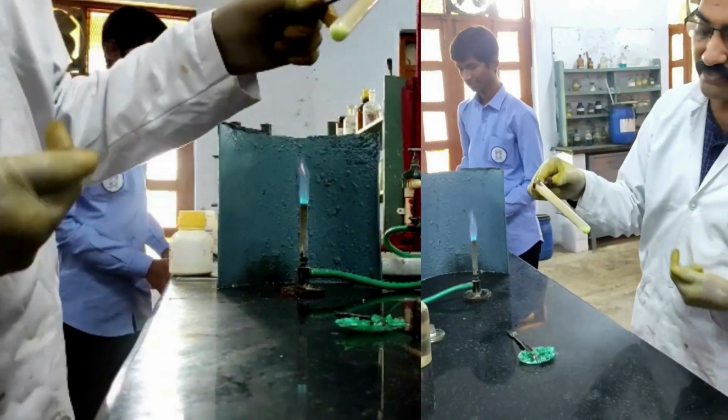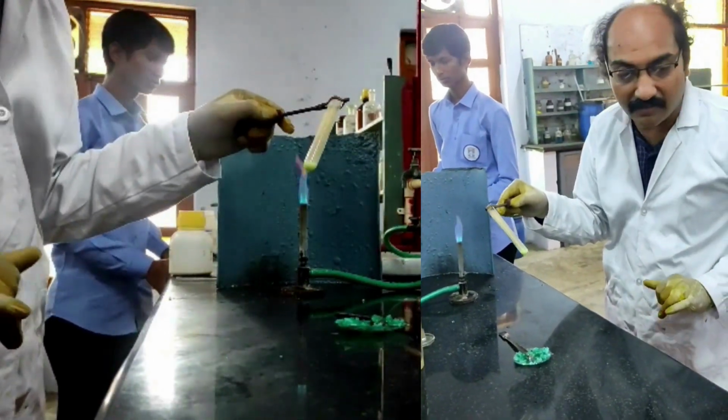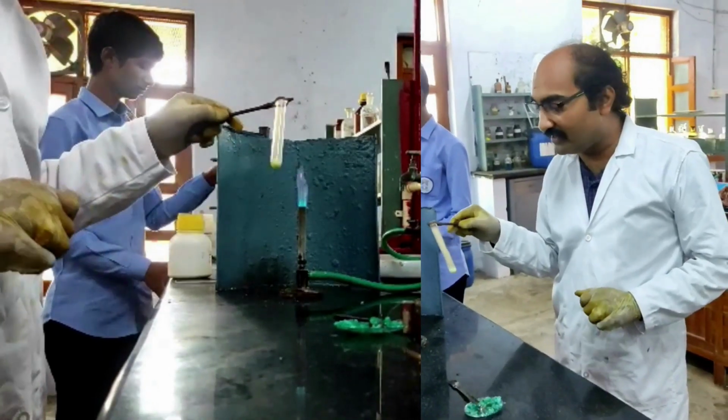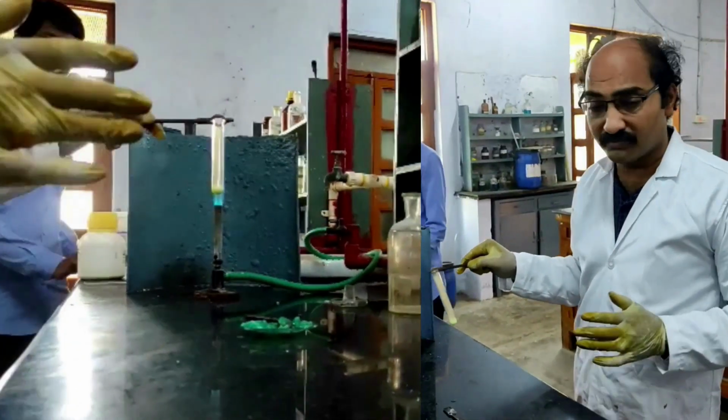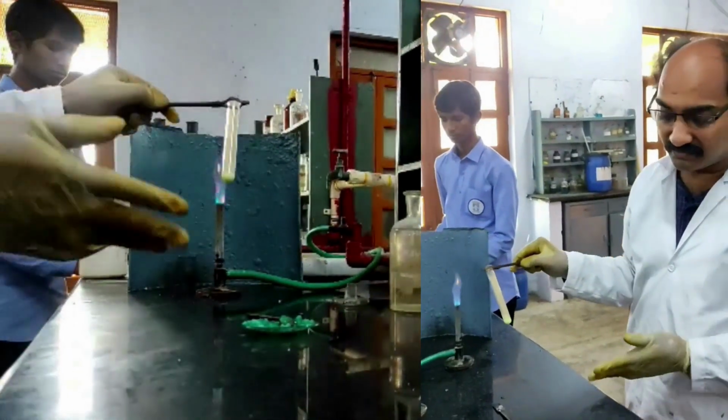Yes. Which indicates the presence of nitrate ion. So it is giving me an indication that my salt mixture may contain nitrate ion. This is the first identification of the anion in the given mixture. Until now I got the identification for nitrate in the given salt mixture, so it must contain one more anion. That anion may be borate, phosphate or sulfate, we do not know. So we need to go systematically, first to test for borate, then for phosphate, and then towards the end for sulfate. Let us do those tests now.